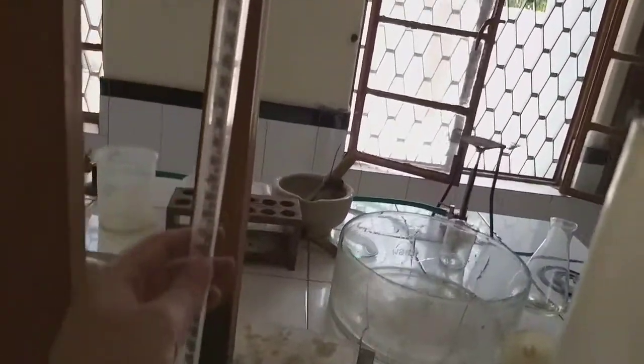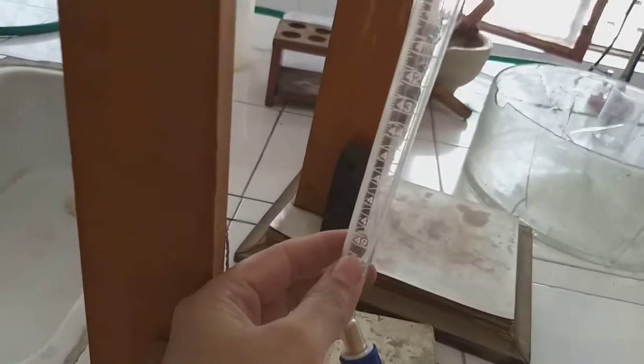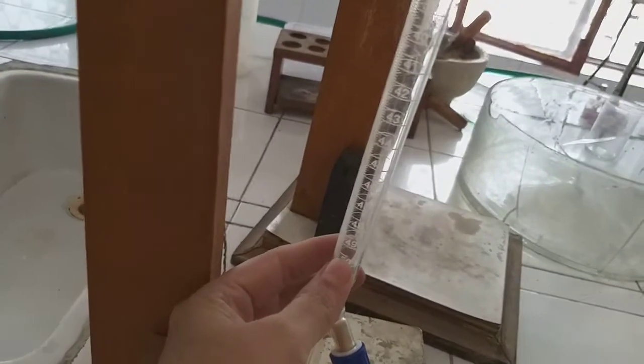We have another apparatus over here. This is called a burette. Now this consists of a very long tube, and you will always find a burette fixed onto a stand, wooden stand or iron stand like this. It is graduated. Now this one is of a 50 ml capacity. So it is graduated from here 0 to 50 here, or maybe sometimes 25, but generally 50 ml.